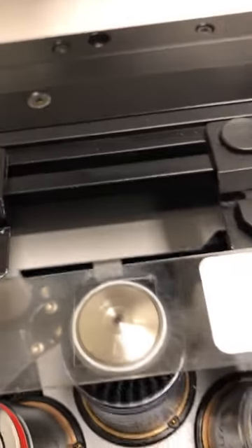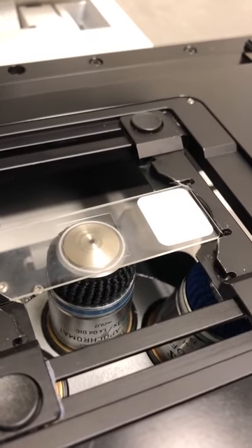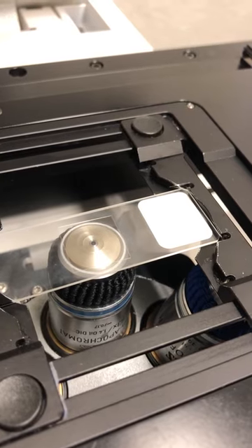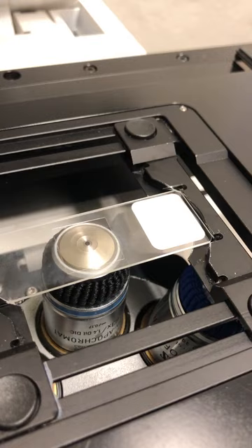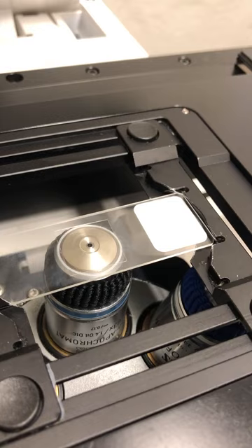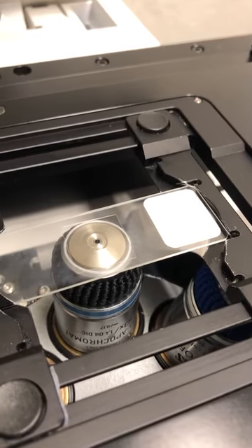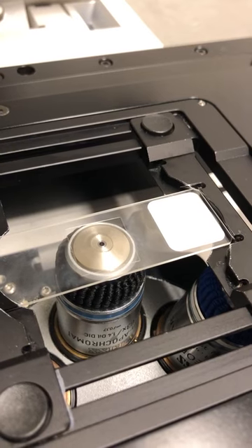In this case it didn't do that - the oil is not touching the sample - so I'm going to raise it by moving the focus knob away from me until the oil does touch the sample. There we go, you can see the oil touch the sample. You can tell because if I move the focus knob towards me the oil slick gets smaller, meaning the objective is going down. If I move it away from me - meaning I move the objective up - the oil slick gets bigger.